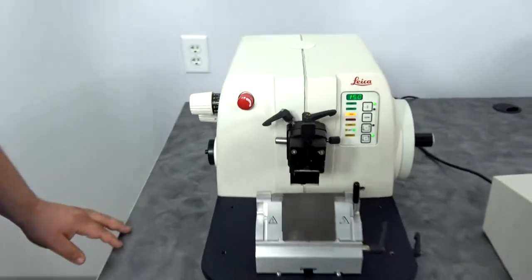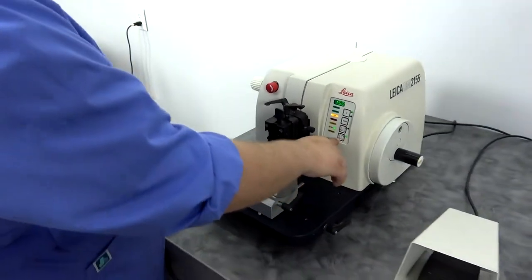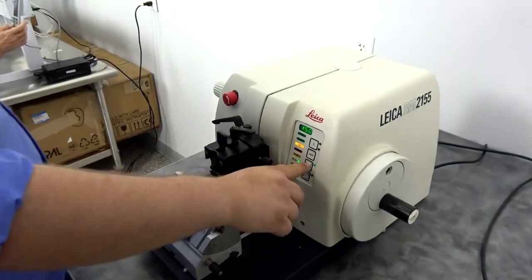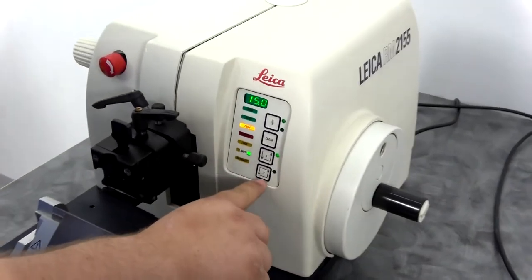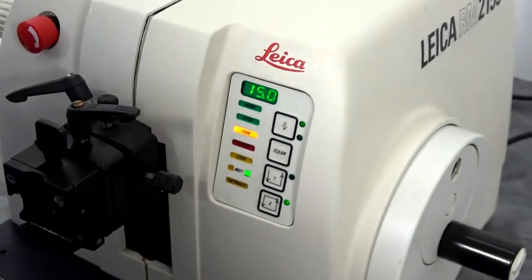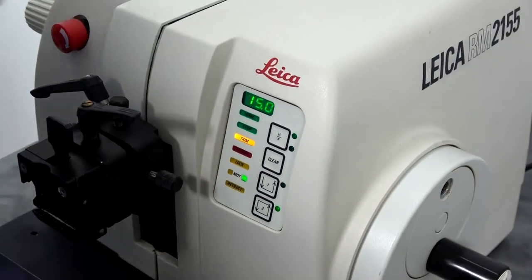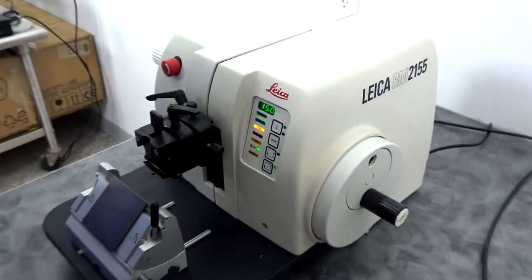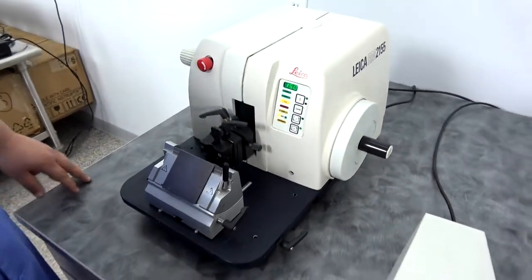Let me show you how this runs. You'll have two cut modes, either single cut here or continuous cut here. We'll put her on continuous and a 15 micron cut. You just tap the foot pedal and there she goes.